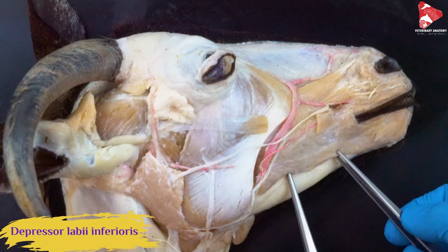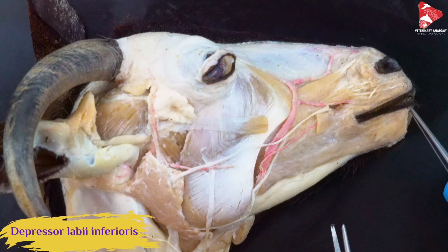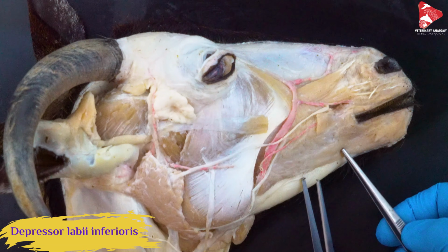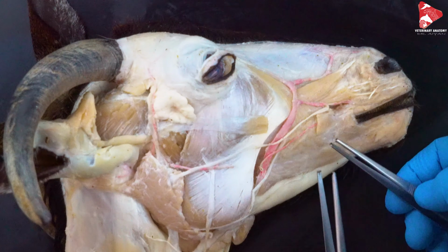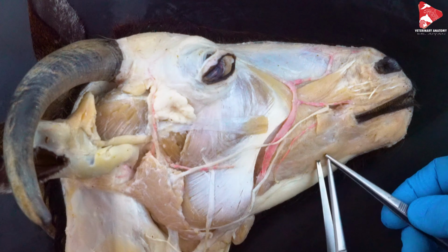From the name, contraction of this muscle will lower the lower lip or move it downward. That's why we name it depressor labii inferioris.